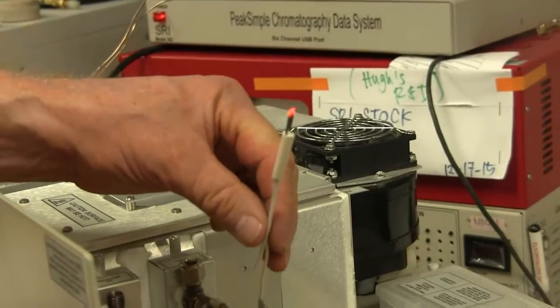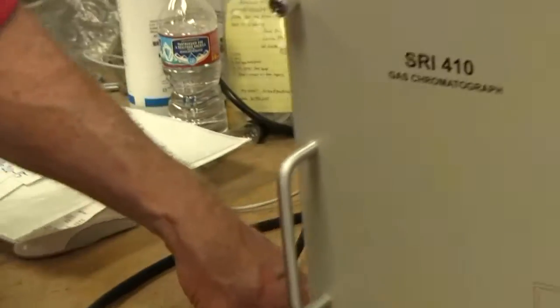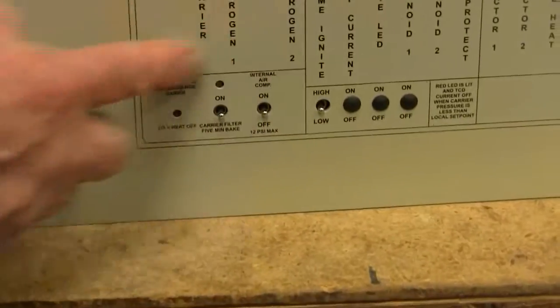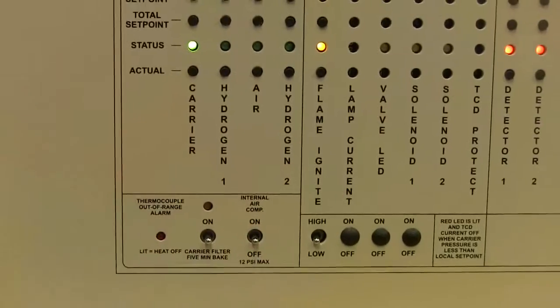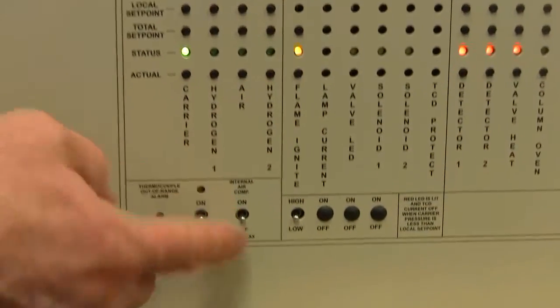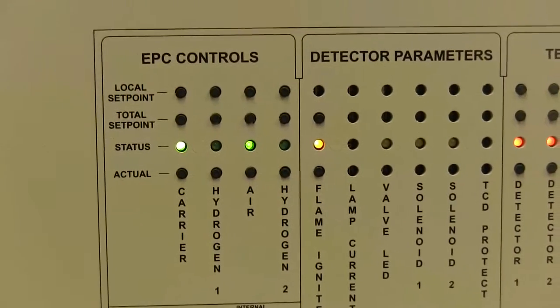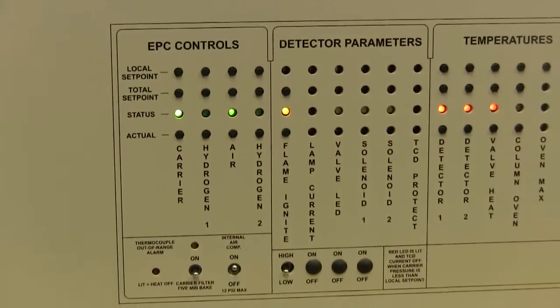The other reason that we see very commonly that the flame is not lit is that the built-in air compressor switch is off. Every GC that we make that has a built-in air compressor, which is most of them, but not all of them, has this switch that says internal air compressor on. So make sure that the air compressor switch is on, because the flame certainly won't be lit if there's no air to support the flame.